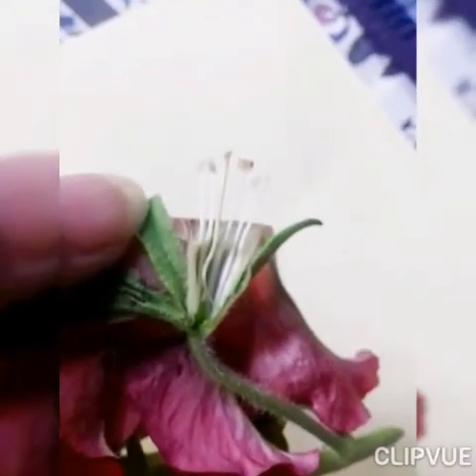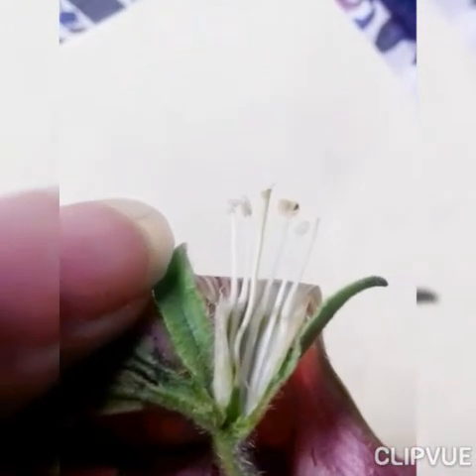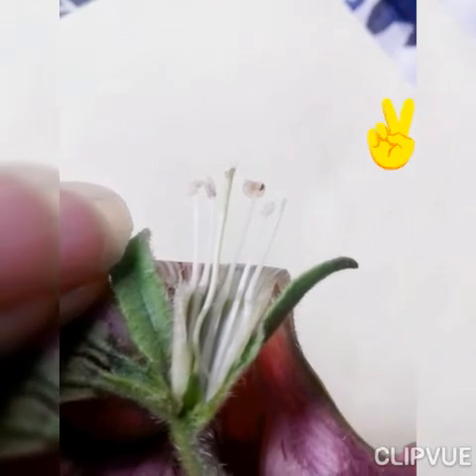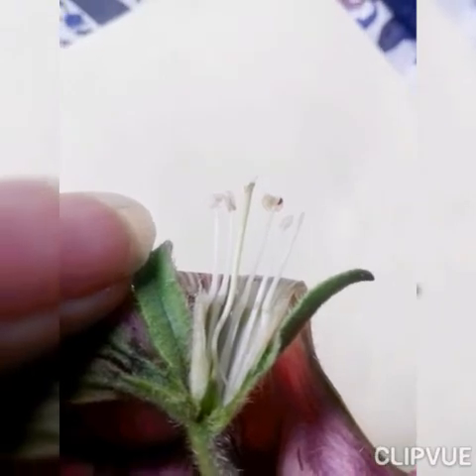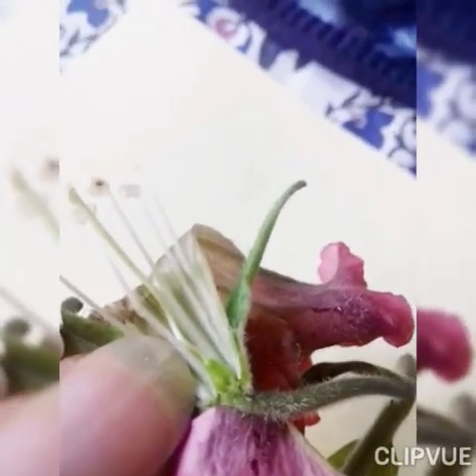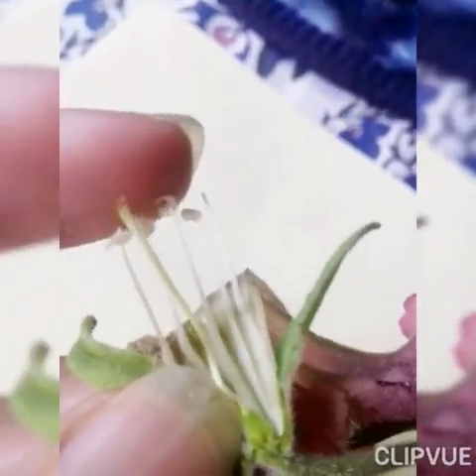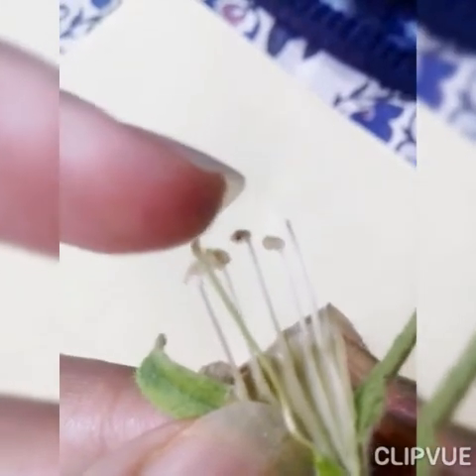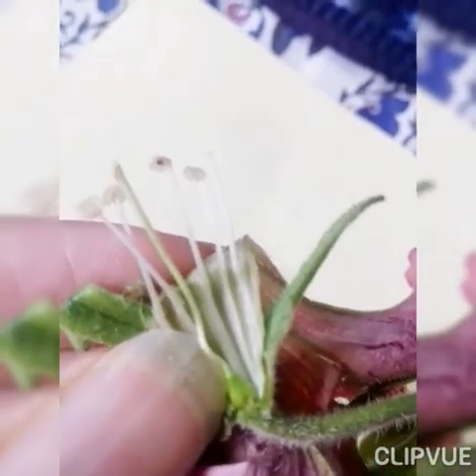I have cut the flower a little bit further in order to see the ovary. Now this swollen part — you can see it clearly — this is called the ovary. So: ovary, style, and this is the stigma. The carpel has three parts: stigma, style, and ovary.